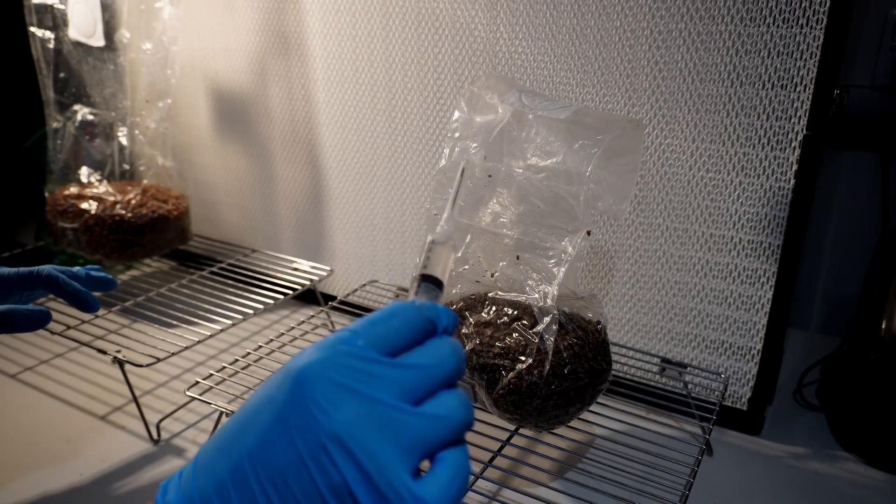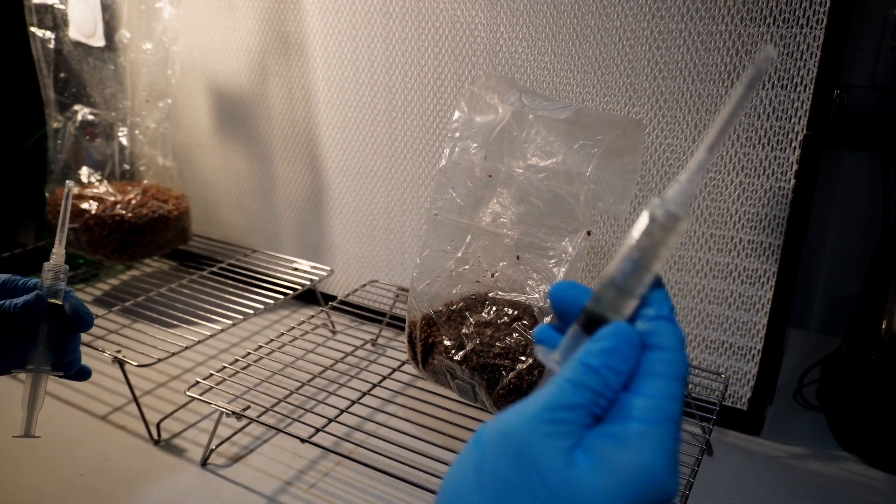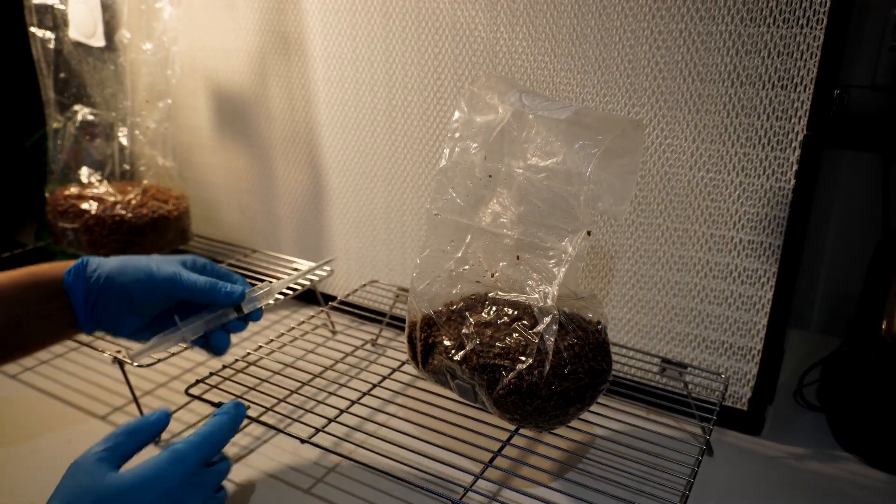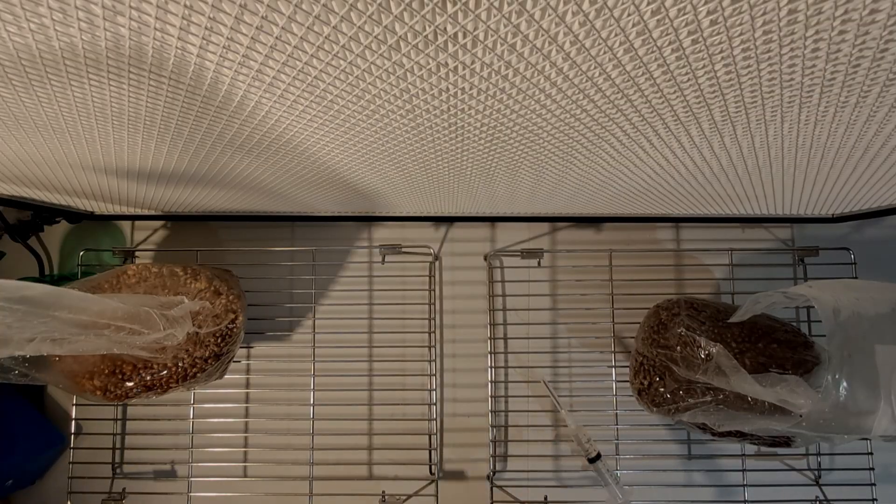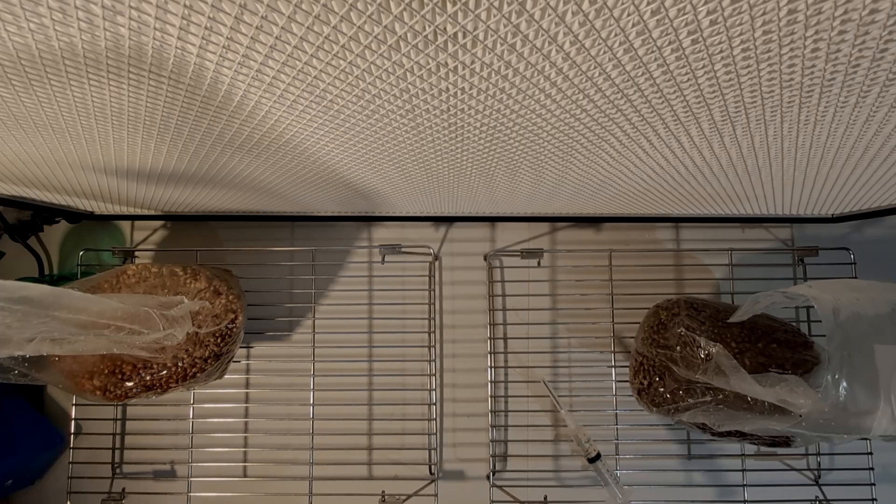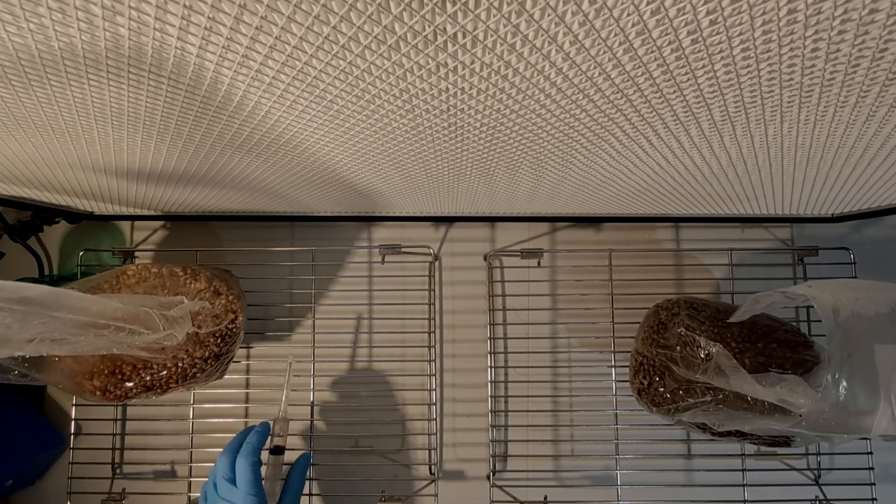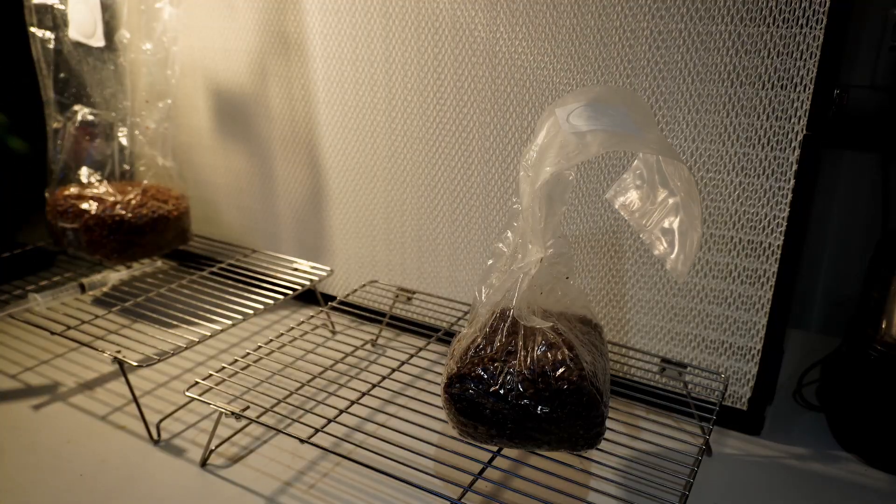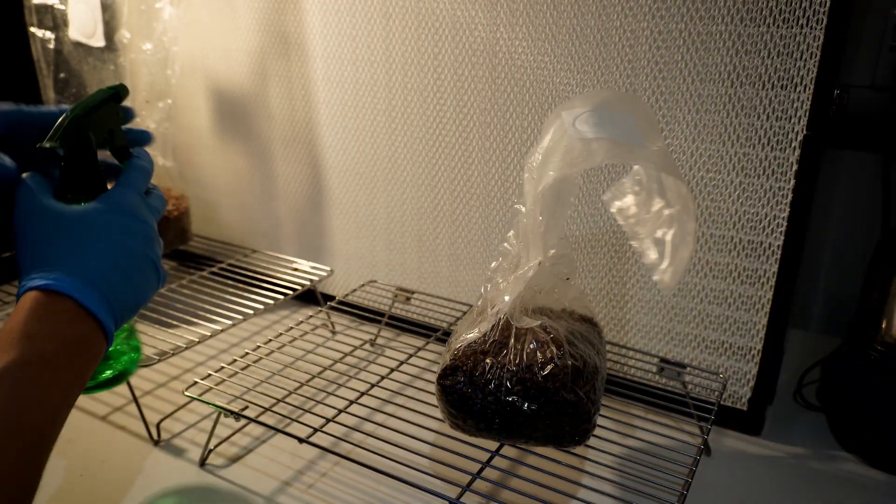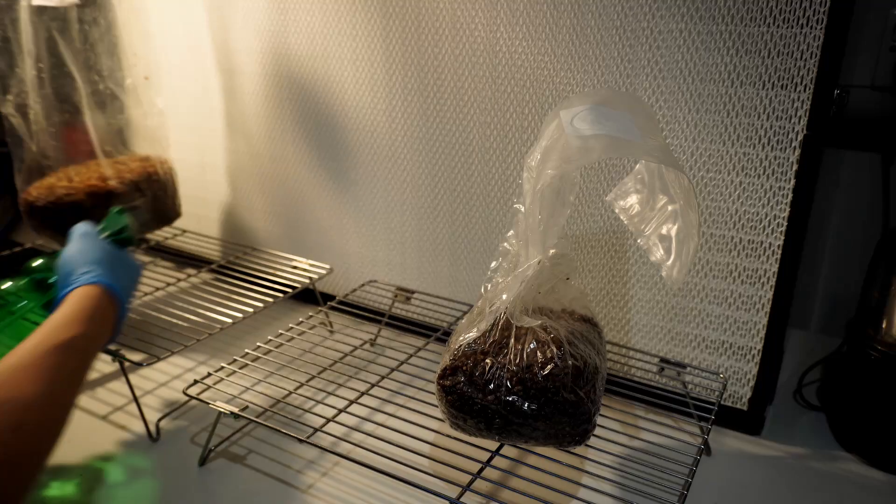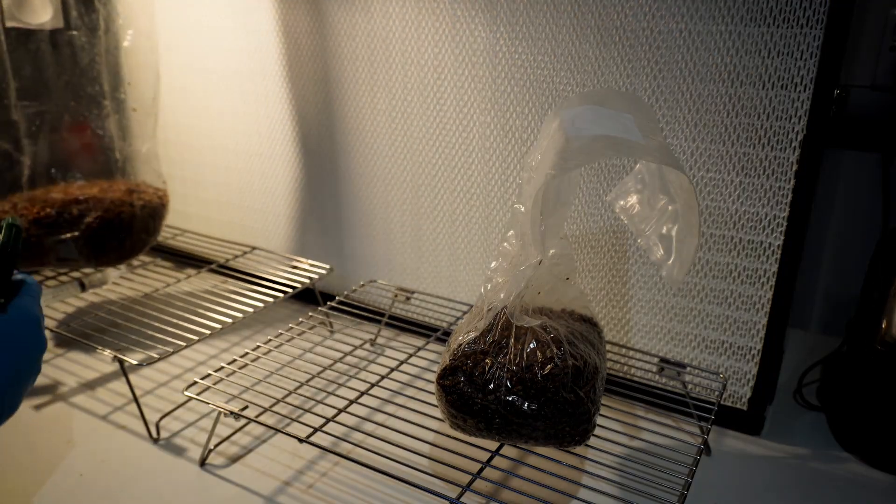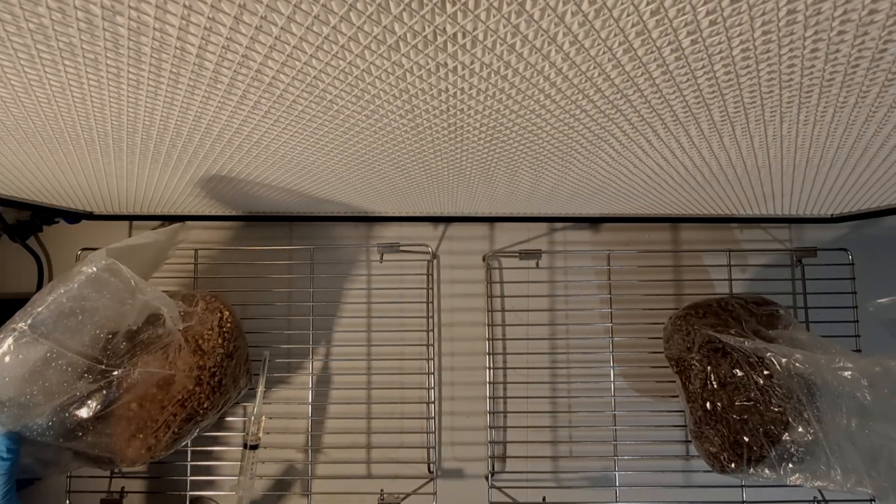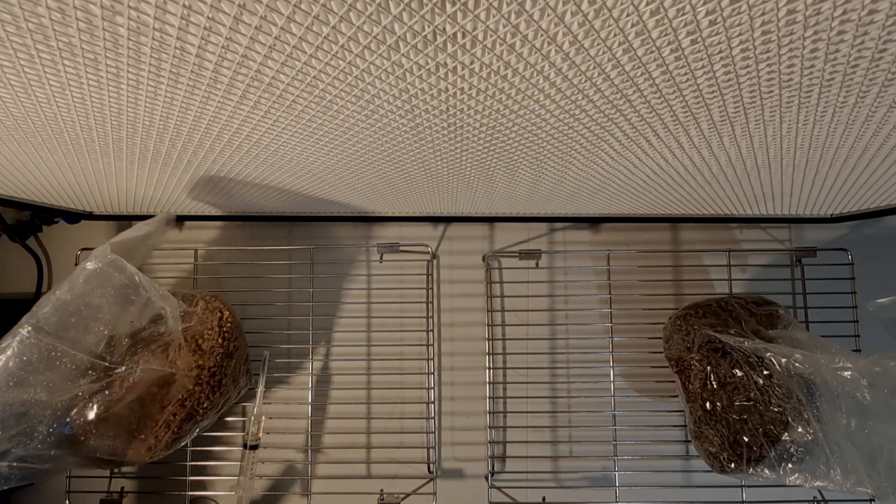I'm going to be reusing the syringe that I was using before and I'm just going to flame sterilize it before use again. You want to make sure that your bags are not blocking the airflow so make sure that they take up as little surface area as possible.